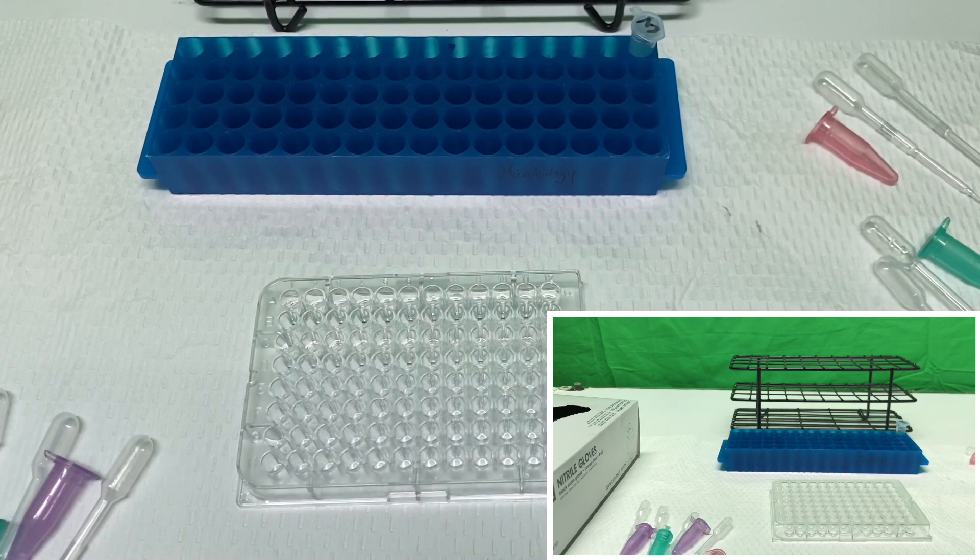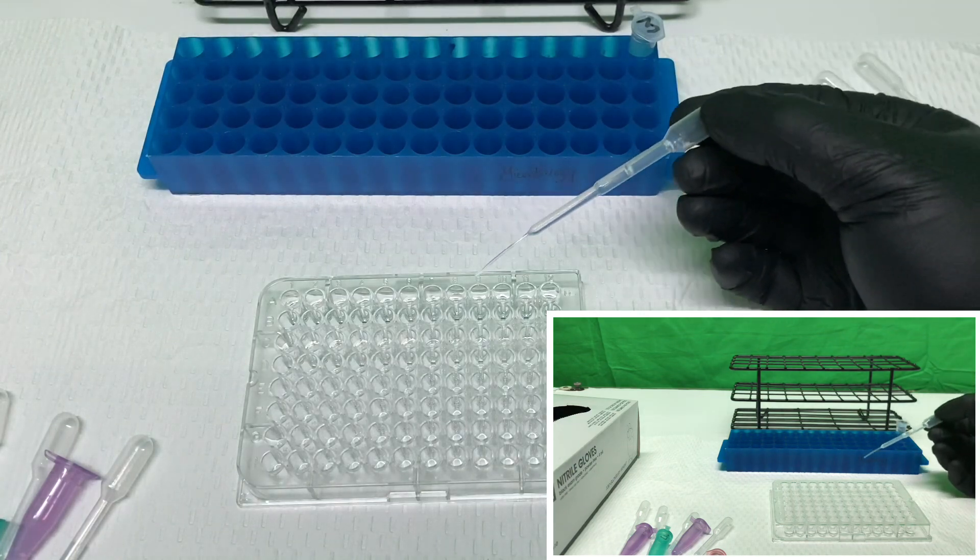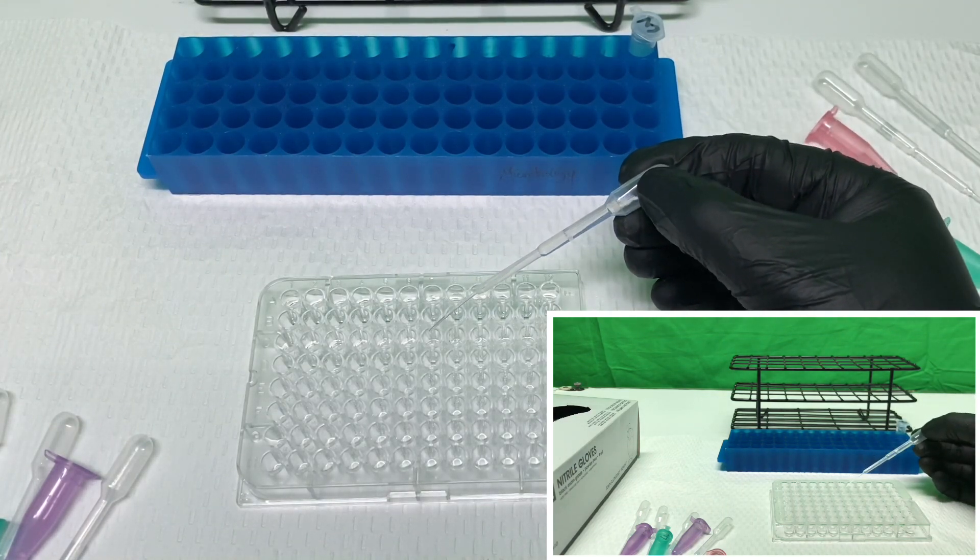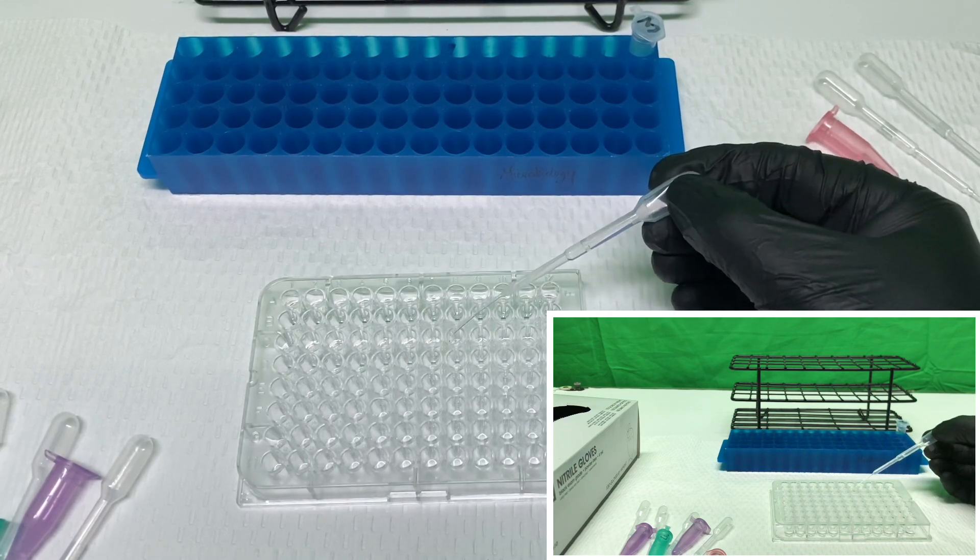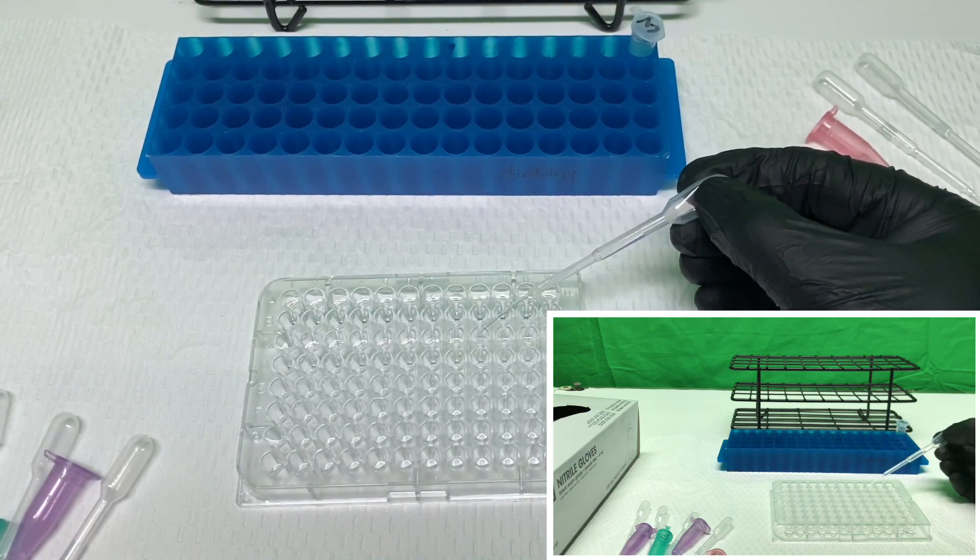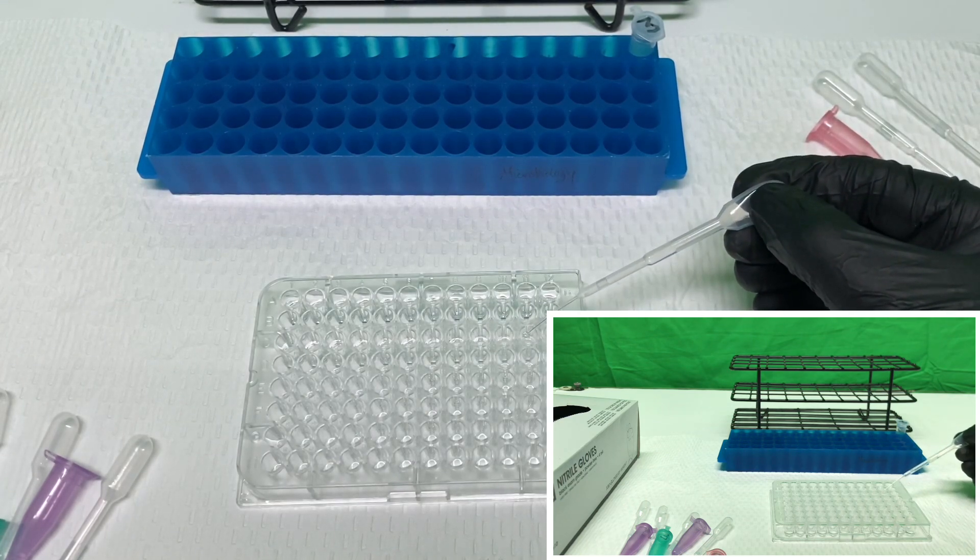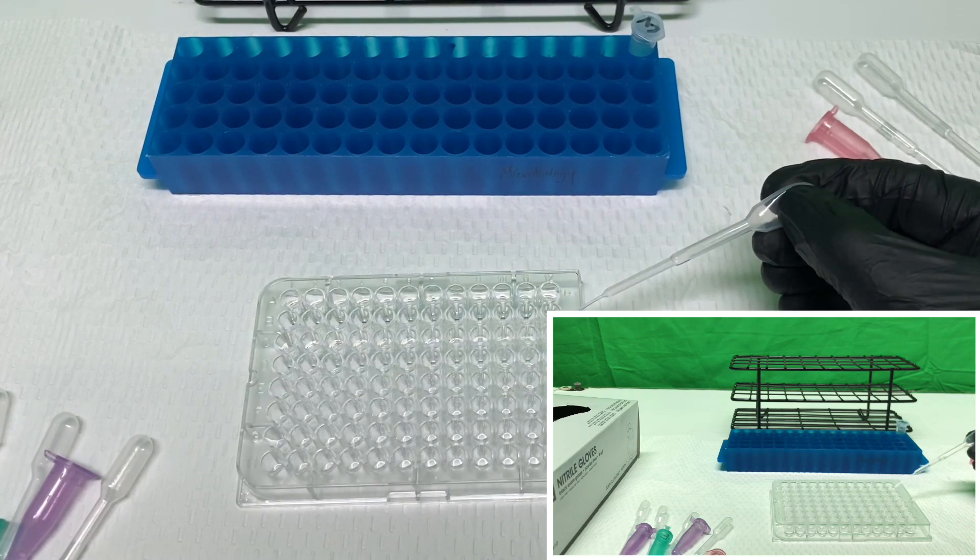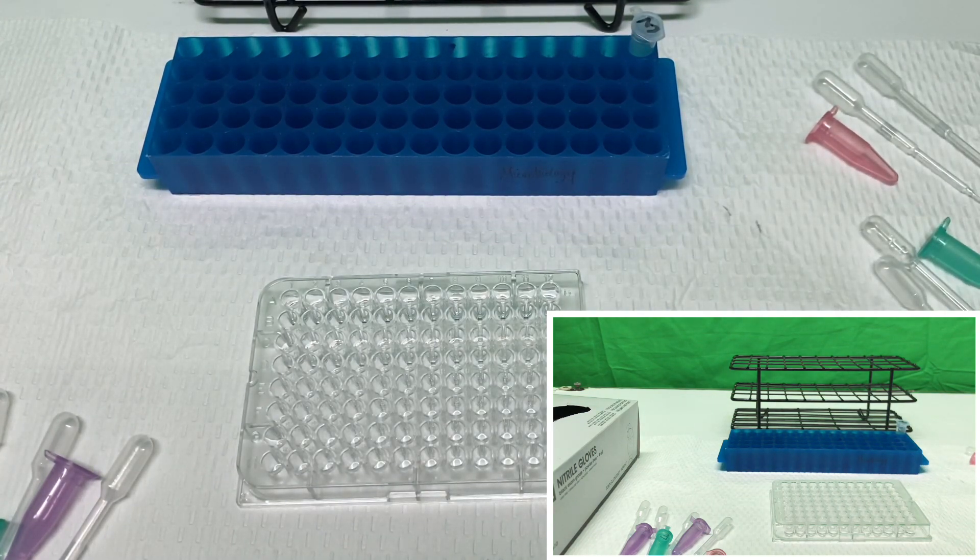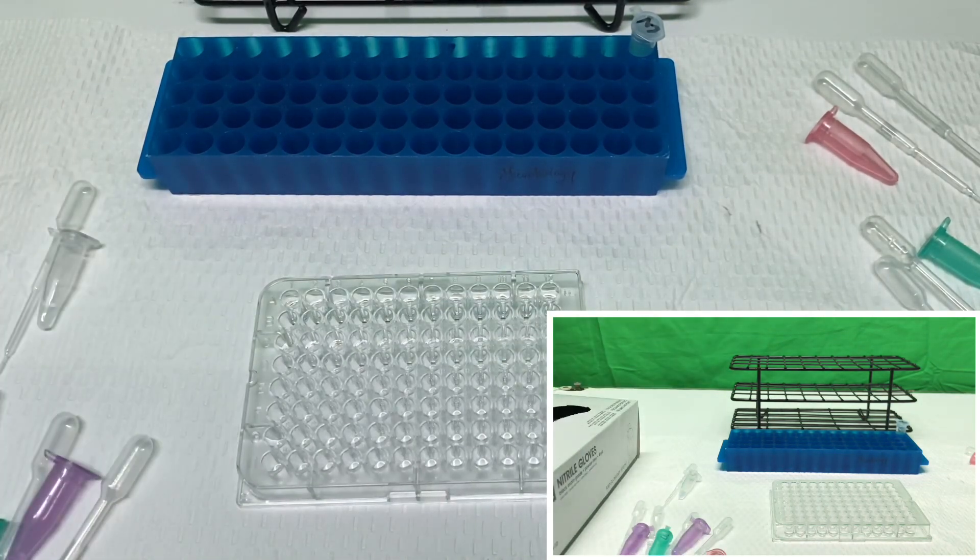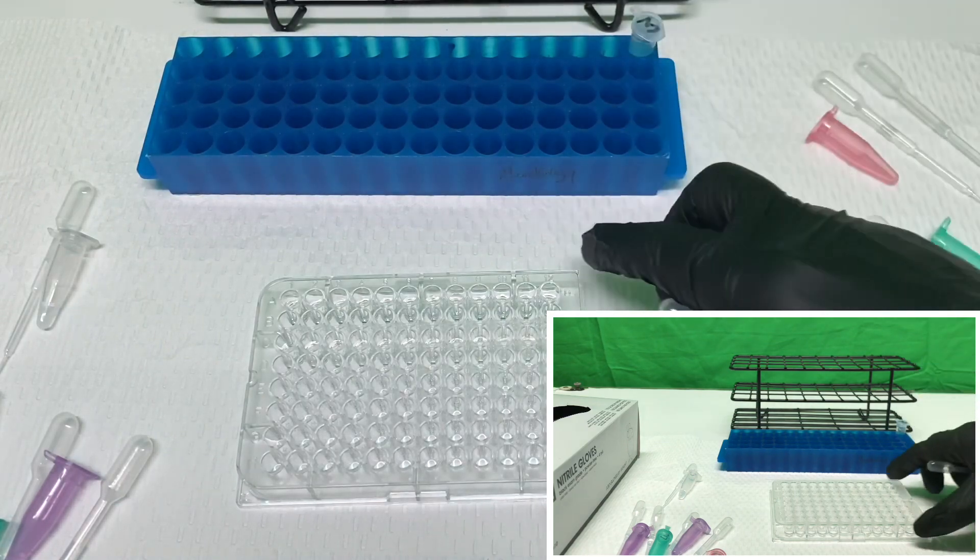Typically, we can rinse these out and empty them. But because each of these antibodies is designed to complex specifically to a particular condition, we don't need to even rinse these out. So now the primary and the secondary antibodies have been added. If a particular state happens to be positive for them, they'll have complex, leaving anything that is unbound to not interact or cause any reactions. So we'll mix this up a little bit more.